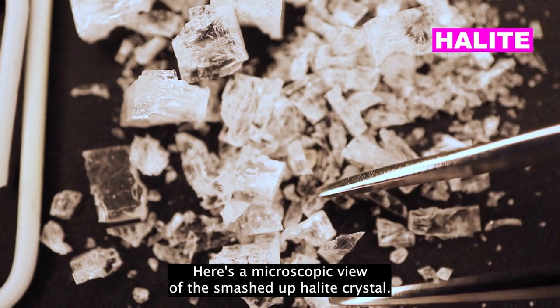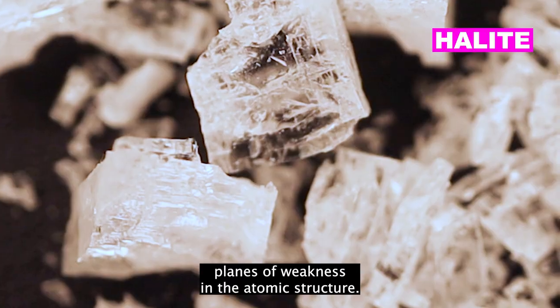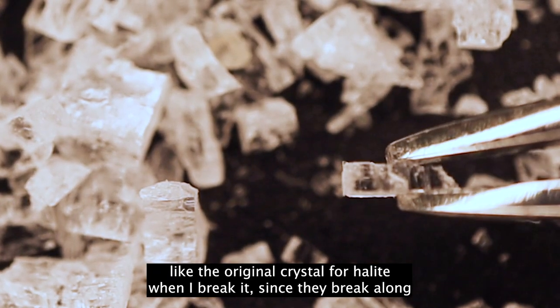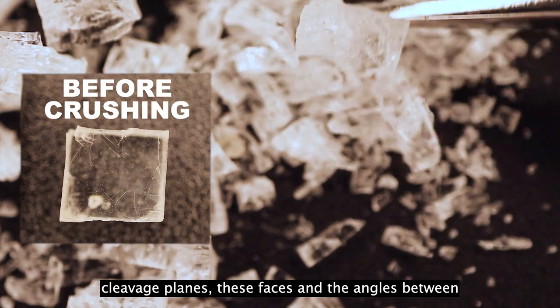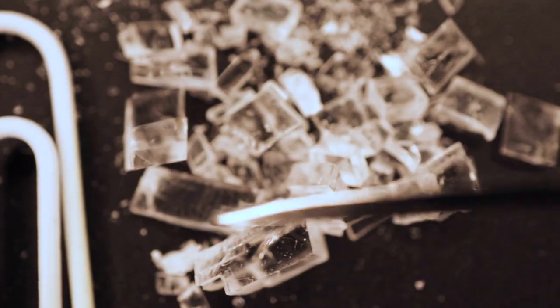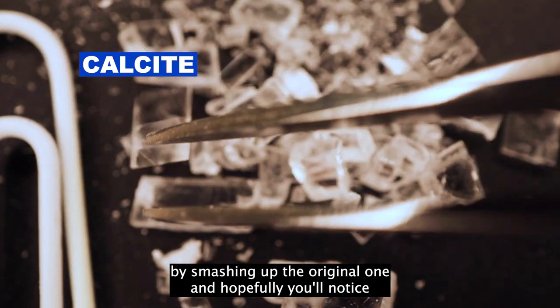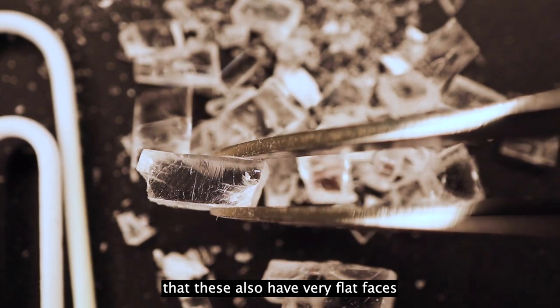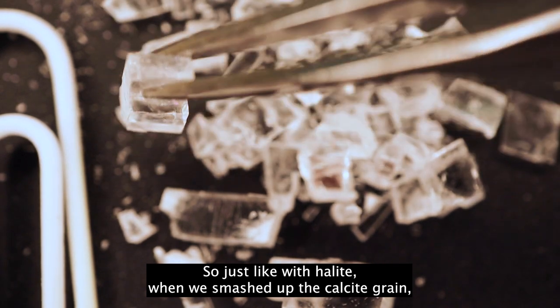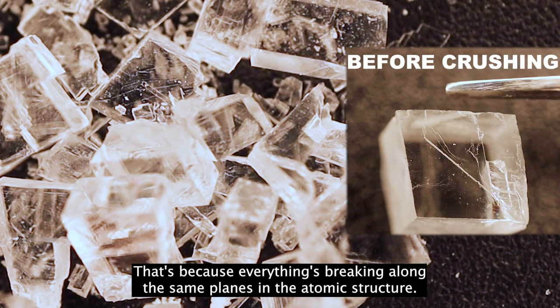Here's a microscopic view of the smashed-up halite crystal. Remember, halite has cleavage, so when it breaks, it breaks along preferred planes of weakness in the atomic structure. Unlike quartz, whose shards didn't look anything like the original crystal, for halite the faces and the angles between the faces in the little shards are going to be very similar to what we started with — halite has really excellent cleavage. And here are our little baby calcite crystals made by smashing the original one. These also have very flat faces and angles that are the same as the original crystal — just like with halite, everything broke along the same planes in the atomic structure.